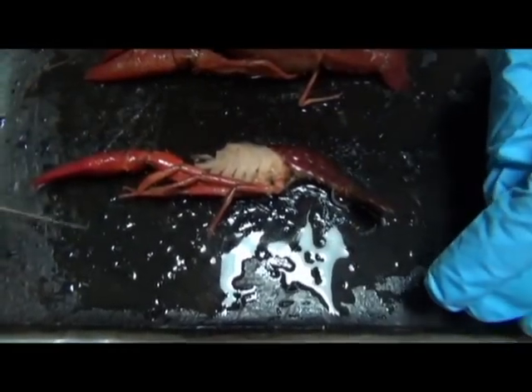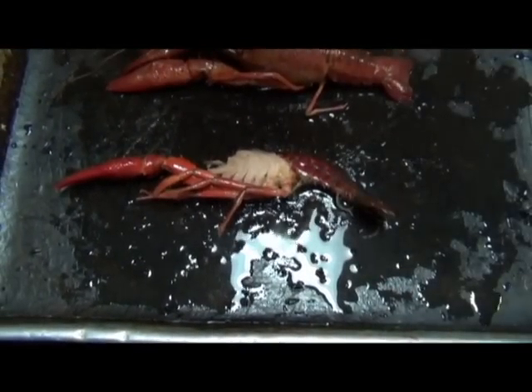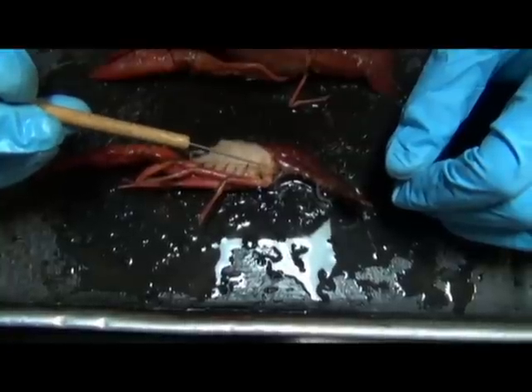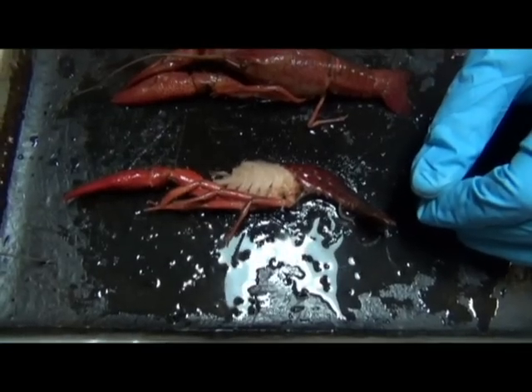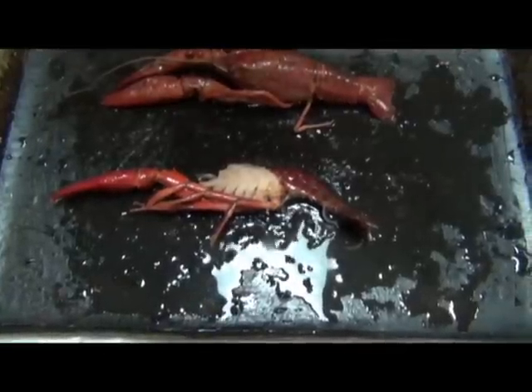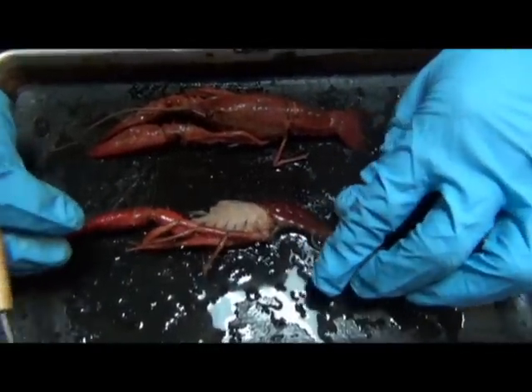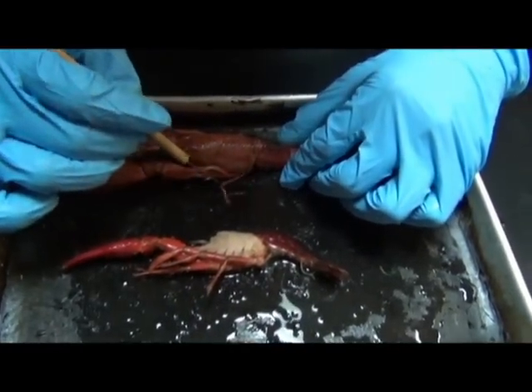many crustaceans, like this guy, and also crabs, have the same overall organization. The walking legs have a shoulder. At the base, you have gills coming out. And so, with the same base for a walking appendage, you also have a breathing appendage there. Okay, and that brings up a really interesting point, actually a unique quality about this group, the Crustacea.